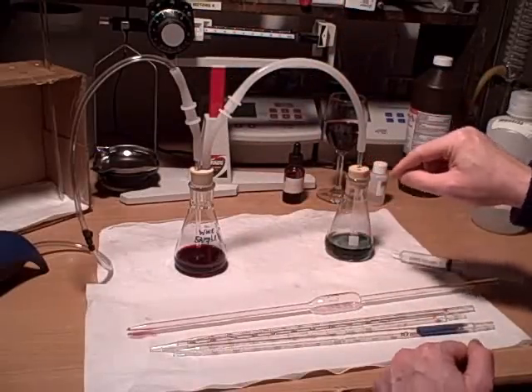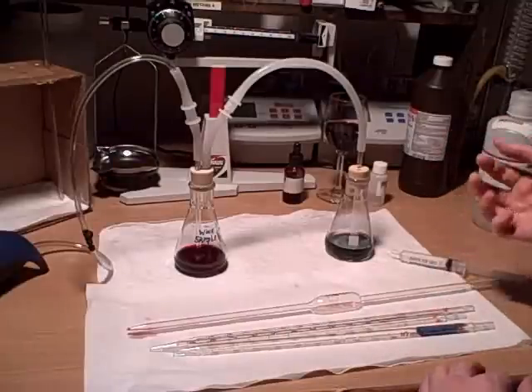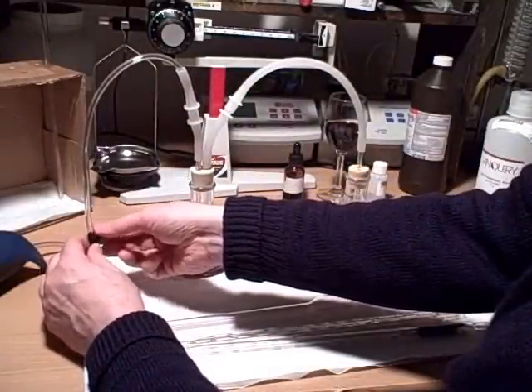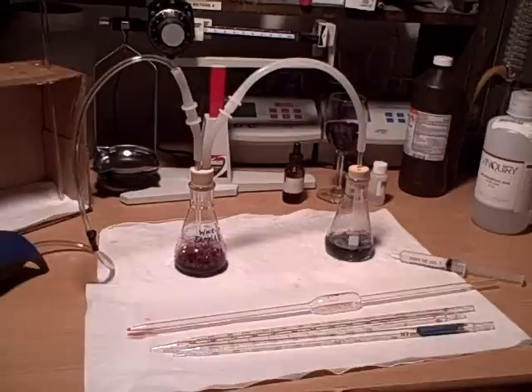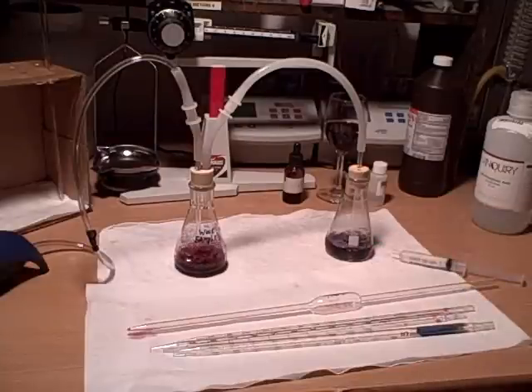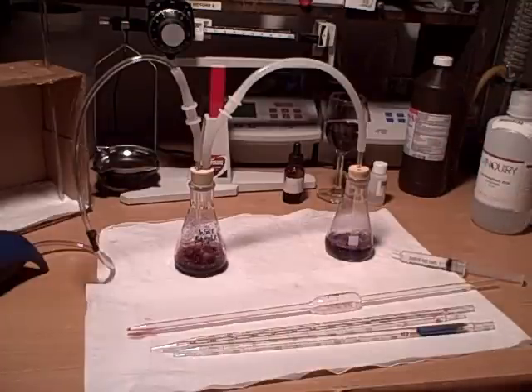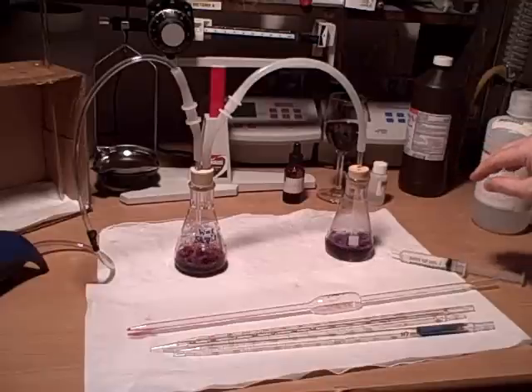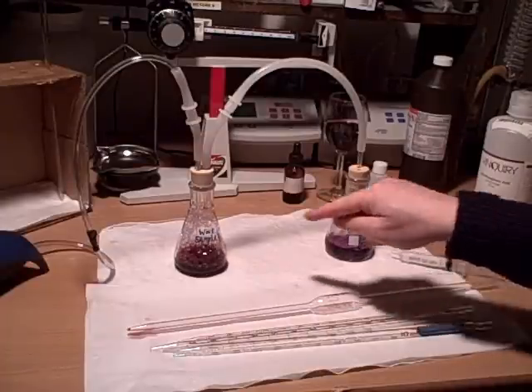So it's a closed system and it comes out here. Whatever gas happens in this impinger will have to go through this liquid to change it. So if there is sulfur, which is acidic, coming through our color solution, it will turn pink. You can see we've gone from a light green already to kind of a charcoal-y color — same as when we added the hydrochloric acid after the distilled water to prepare the hydrogen peroxide system, where it went from a green to a charcoal-y grayish color back to pink. That's showing evidence that indeed there is sulfur gas in our wine sample.